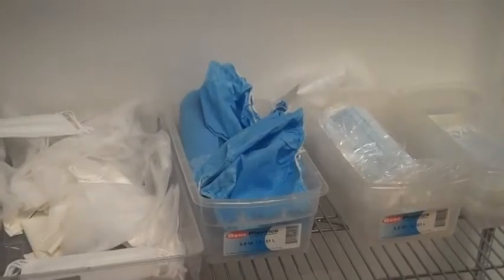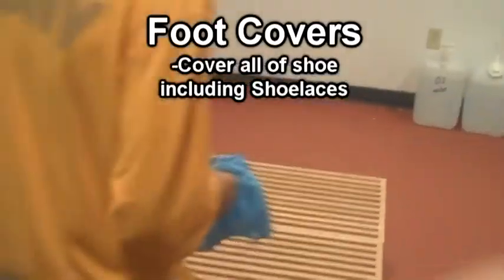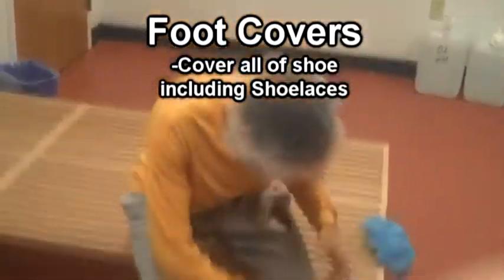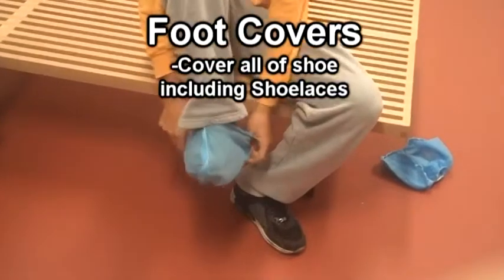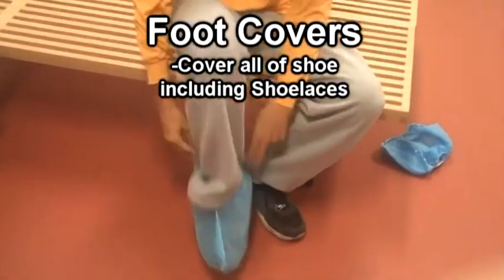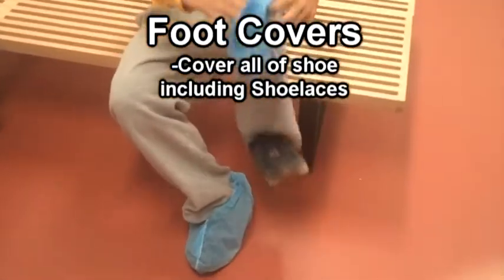Next, it's time to put on the blue foot covers. Slip the foot covers over your shoes and make sure they cover the entire shoe, including the shoelaces.